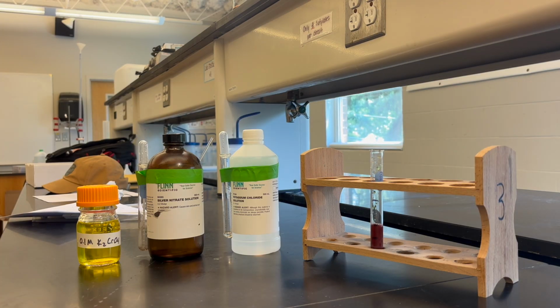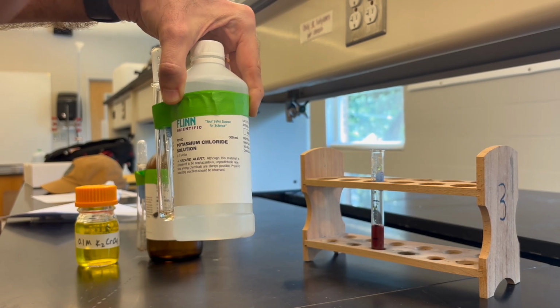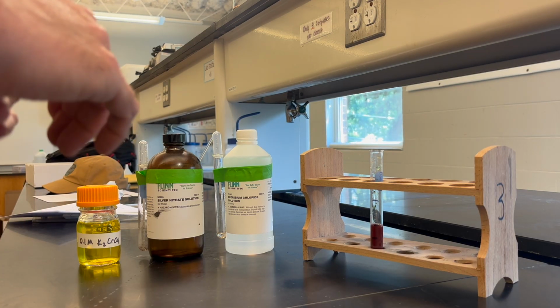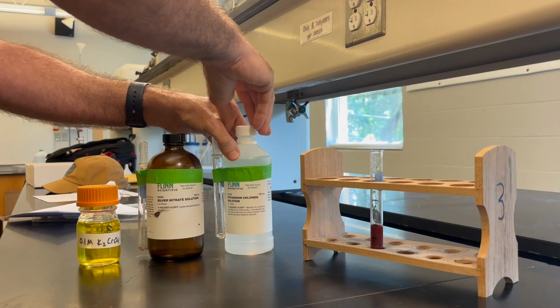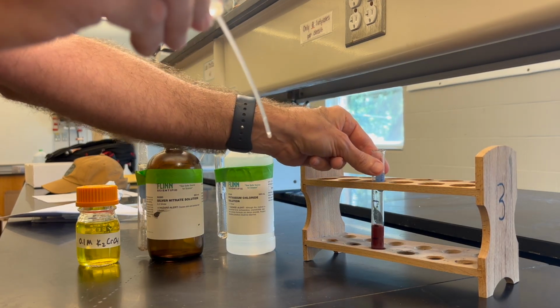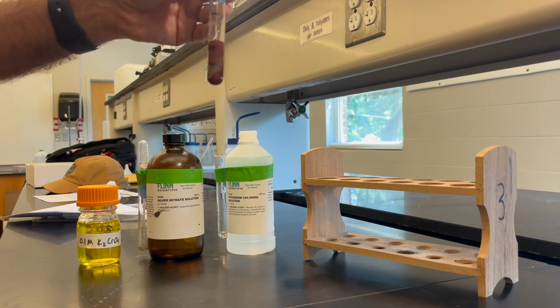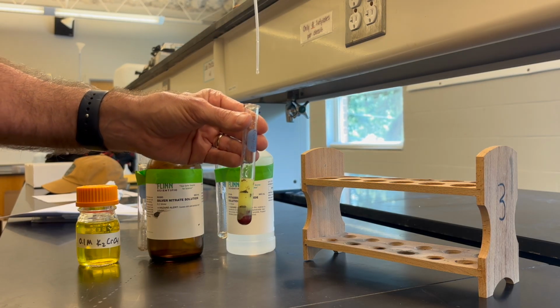So then there are several questions within the lab that they have to answer. And then they get to part two, where they're going to add potassium chloride to what's already in that test tube. And so again, one test tube will be for reference. The second test tube, now they're going to add the potassium chloride solution to that. The procedure is adding an excess of potassium chloride because I want there to be no doubt in the student's mind which substance is less soluble, right? Which one has the smaller KSP. So I'm going to go ahead and add 6 milliliters. I might have said 10 before, but I'm going to add 6 milliliters up to the 10 milliliter mark.